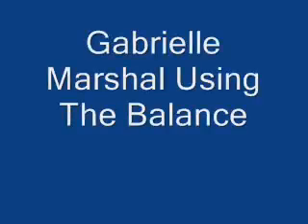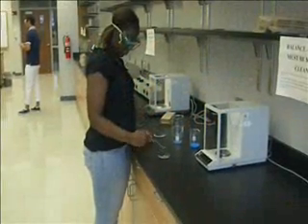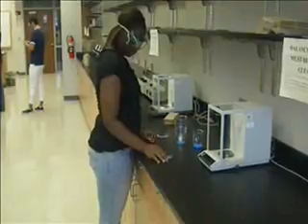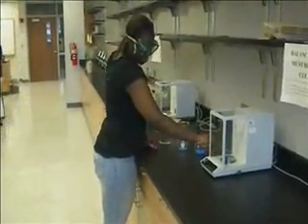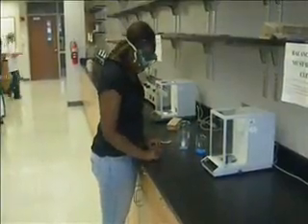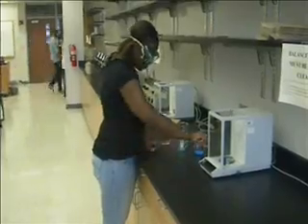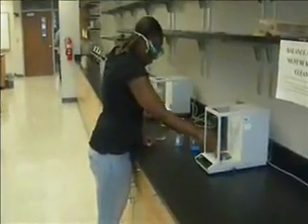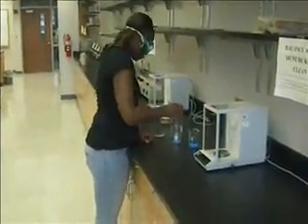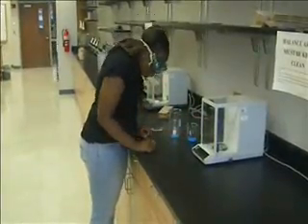In the following video segments, each lab partner can be seen performing one measurement cycle of a blue powder compound. The tared glassware is first removed from the balance, and the blue powder compound is transferred to the glassware for weighing. The glassware is then placed onto the balance's weighing platform, and the door is closed. After allowing the balance's display to settle, the displayed weight is called out to a lab partner who is recording the measured values. This is the initial weight, or the weight of the vessel and compound combined, referred to as WI. The glassware is then removed, and the compound is transferred to the destination container.